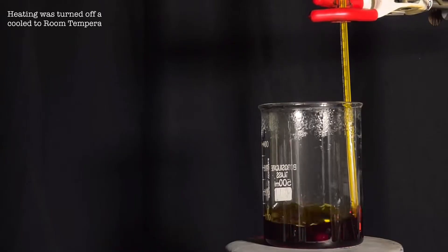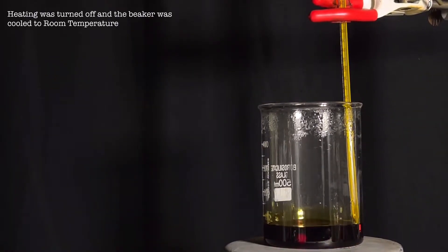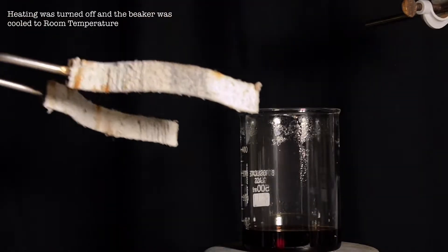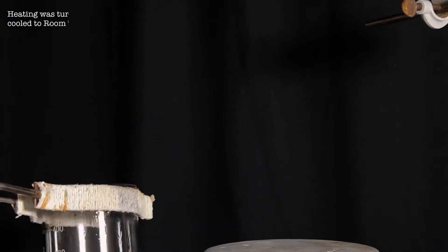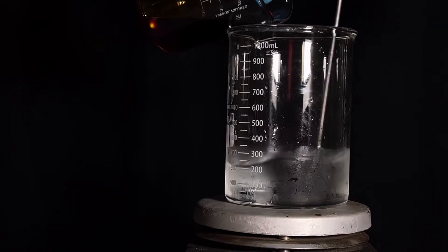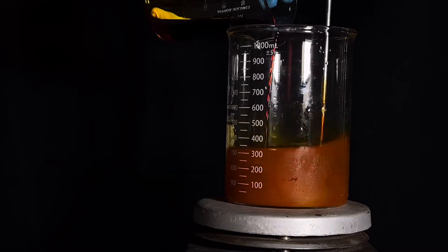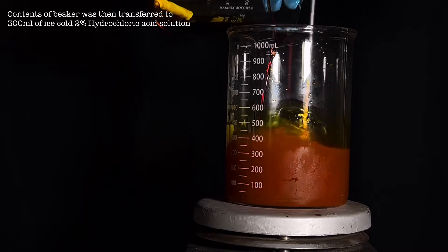After a few minutes, heating was stopped and the beaker was allowed to come to room temperature. When the contents are cooled down, it is poured into around 300 ml of ice-cold 2% hydrochloric acid solution in water. Immediately, a deep yellow-brown precipitate of the crude product crashes out.